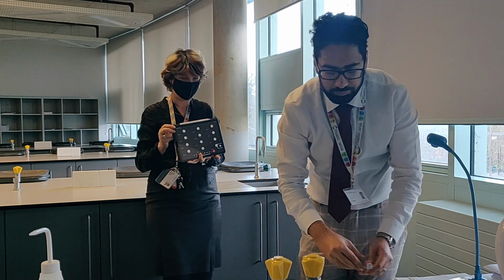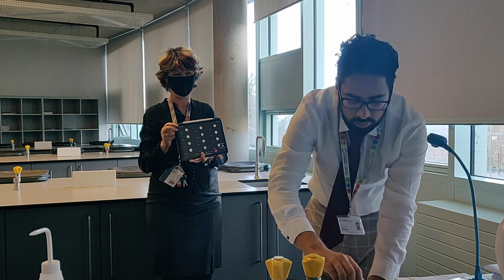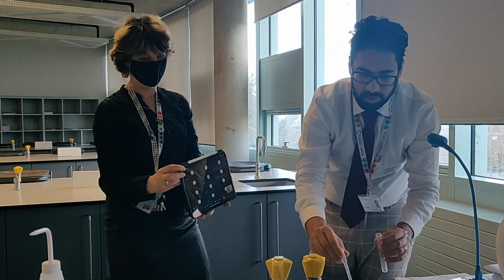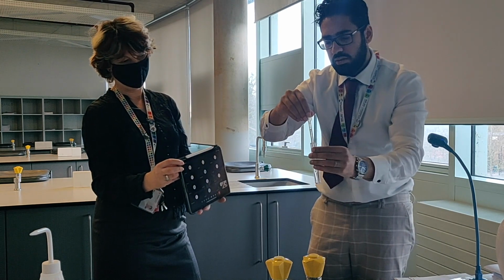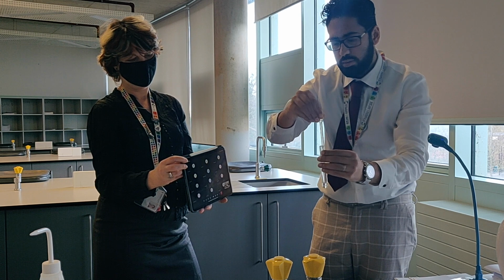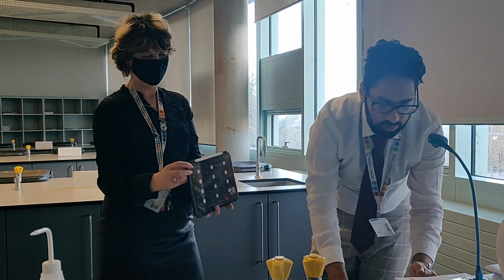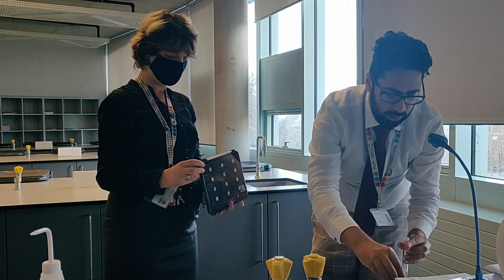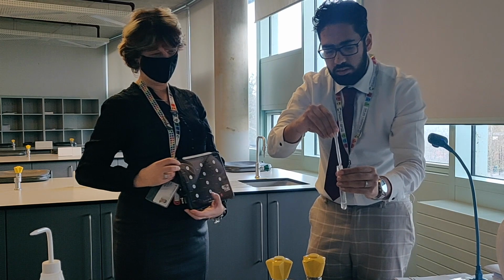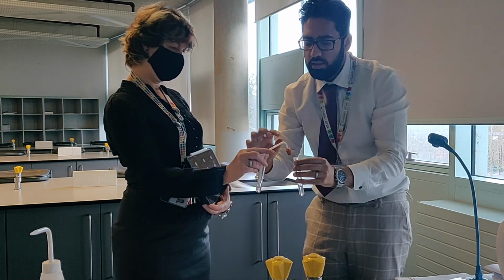So, sodium carbonate solution. Okay, approximately 3 centimeters cubed. So not too much again. Spread it about enough. And then hydrochloric acid, an equal volume, so again around 3 centimeters cubed. And they're going to start reacting straight away, so I'm going to need to do this quickly.